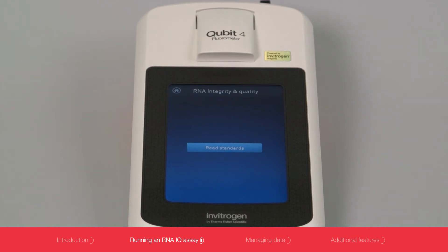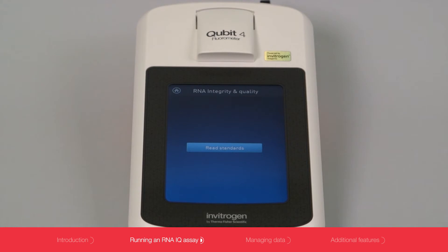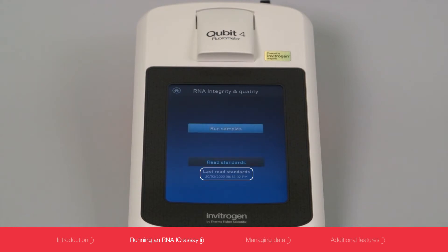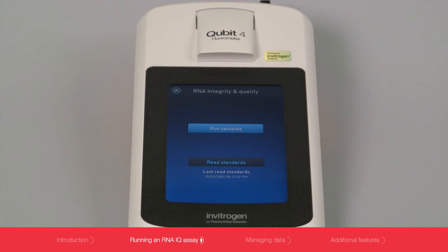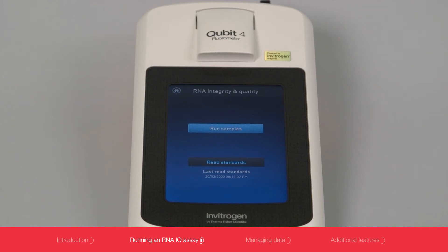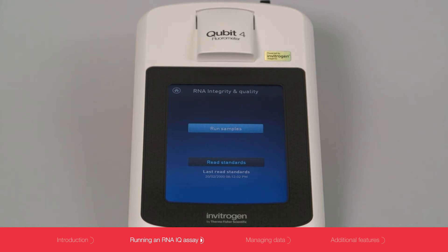The first time you run an assay, you will only see READ STANDARDS. The instrument will save the standards with a time and date stamp. For subsequent assays, you can choose whether to use the saved standards or run a new standard calibration.